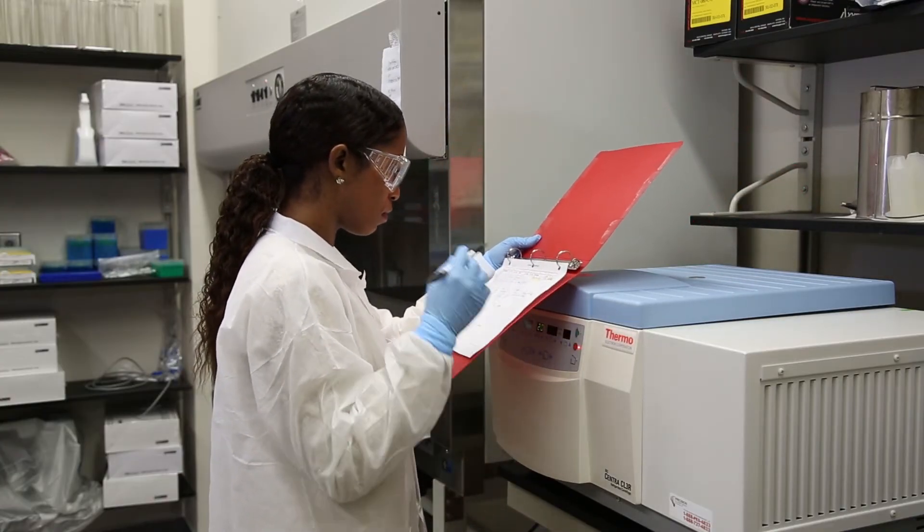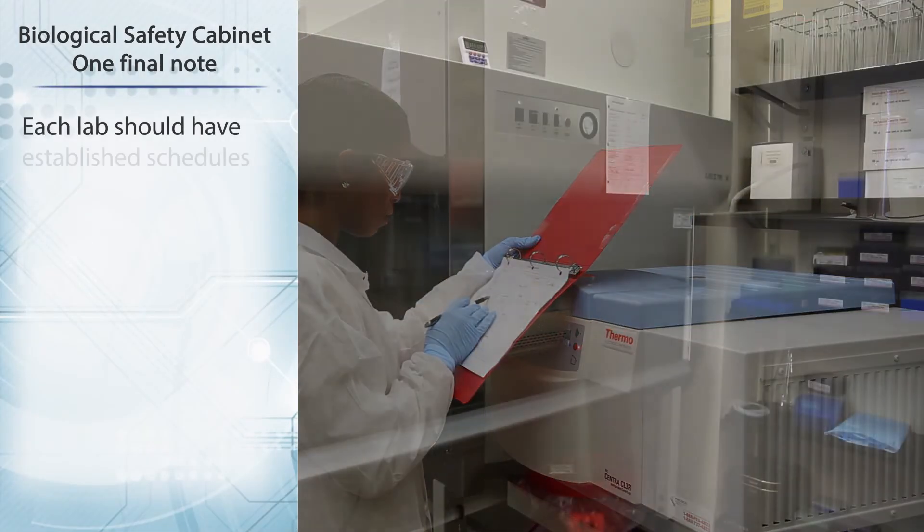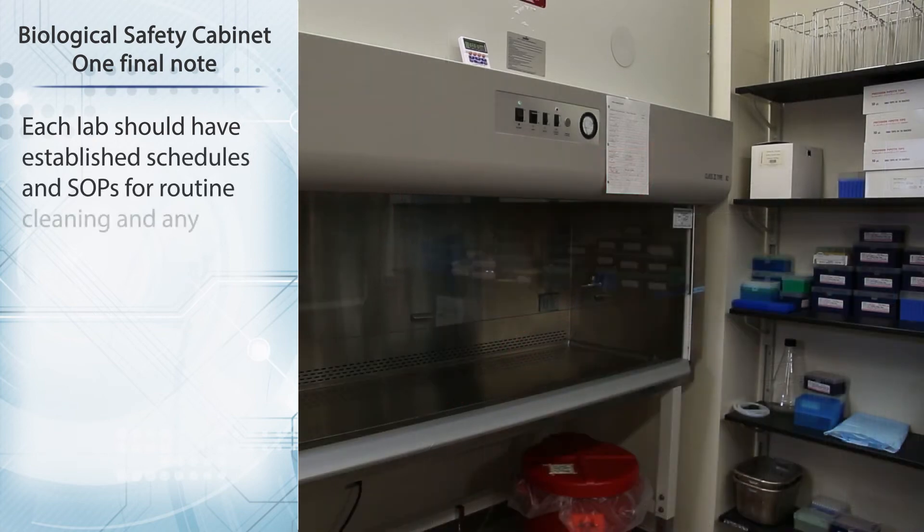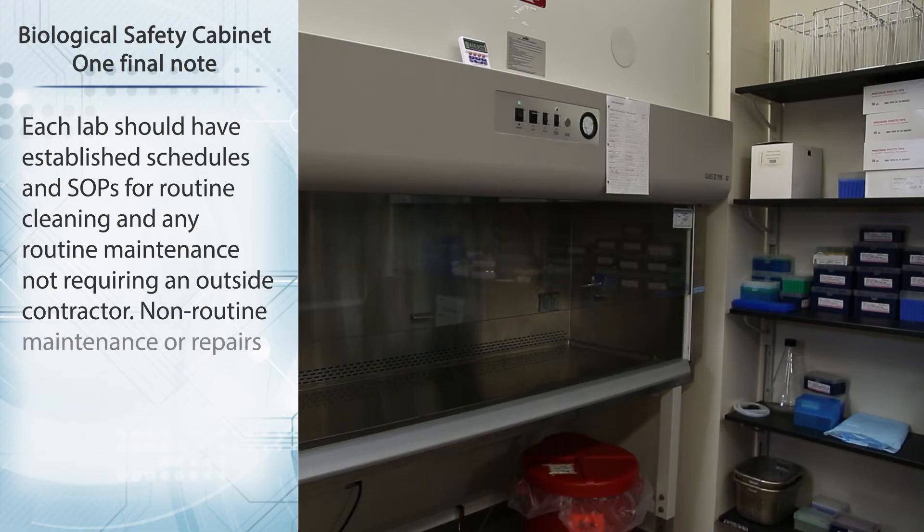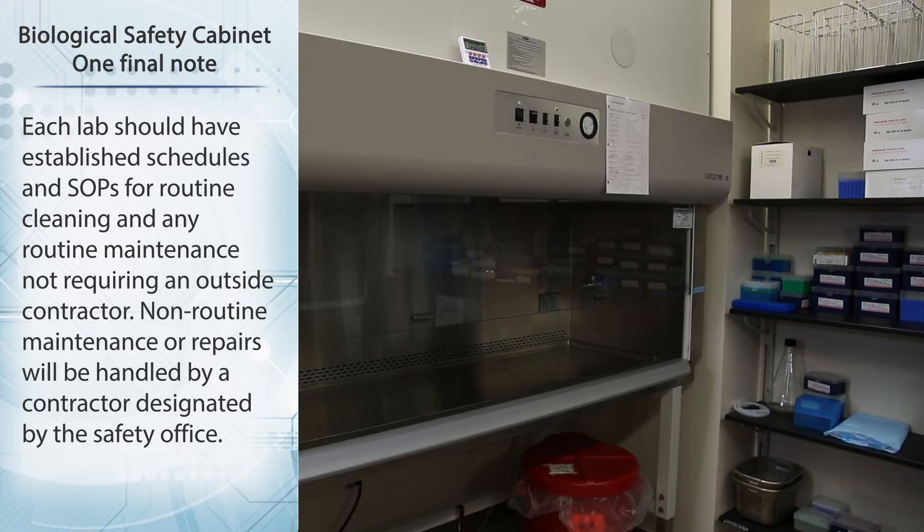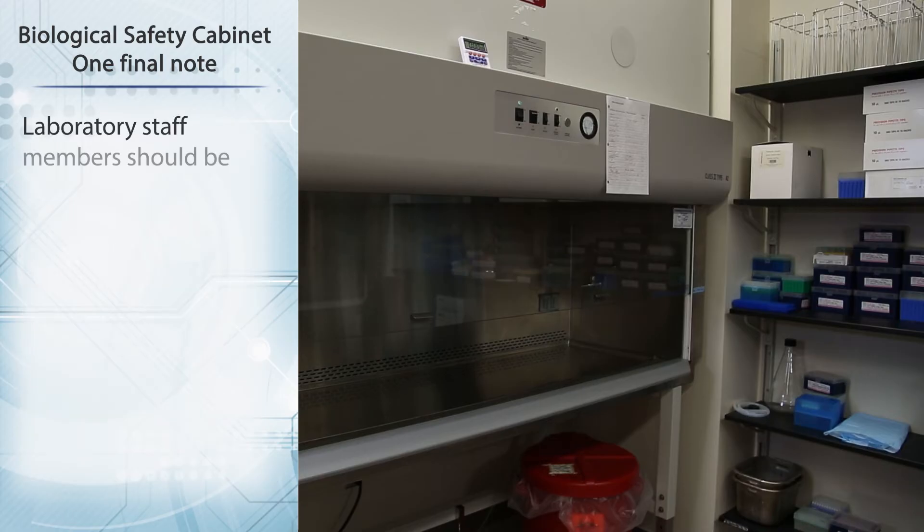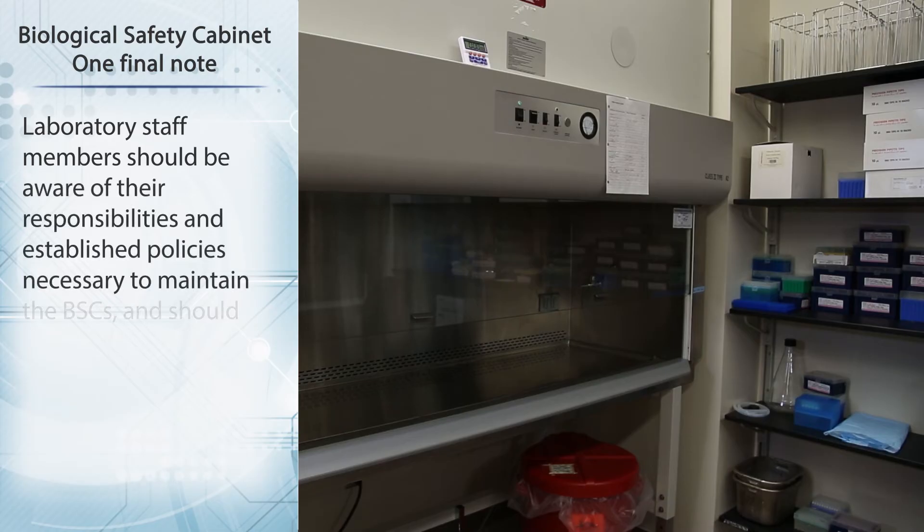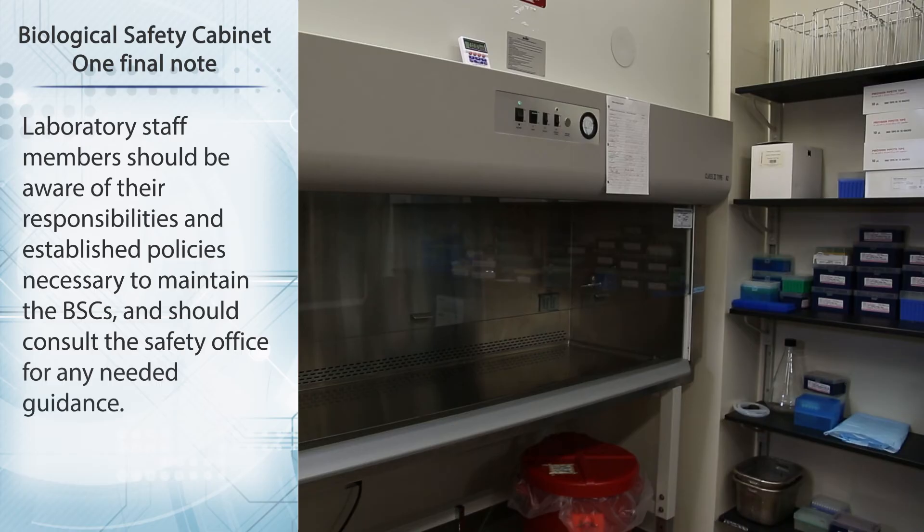One final note. Each lab should have established schedules and SOPs for routine cleaning and any routine maintenance not requiring an outside contractor. Non-routine maintenance repairs will be handled by a contractor designated by the safety office. Laboratory staff members should be aware of their responsibilities and establish policies necessary to maintain the BSCs, and they should consult the safety office for any needed guidance.